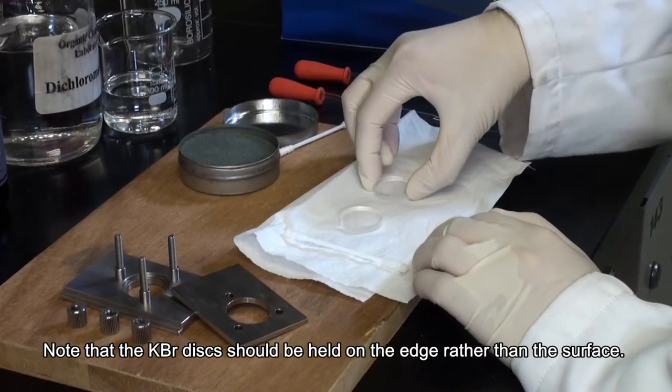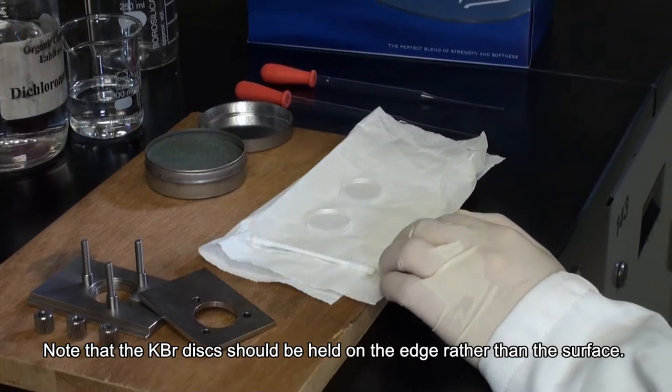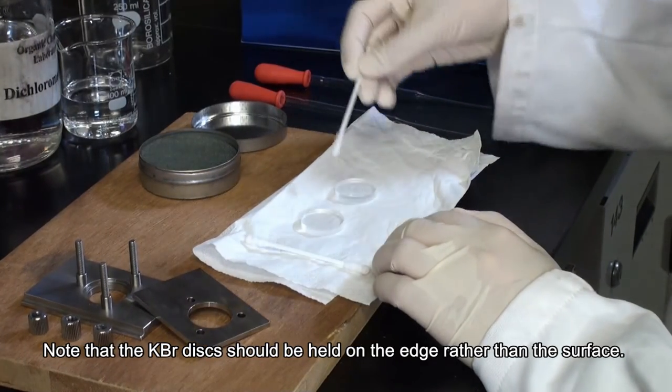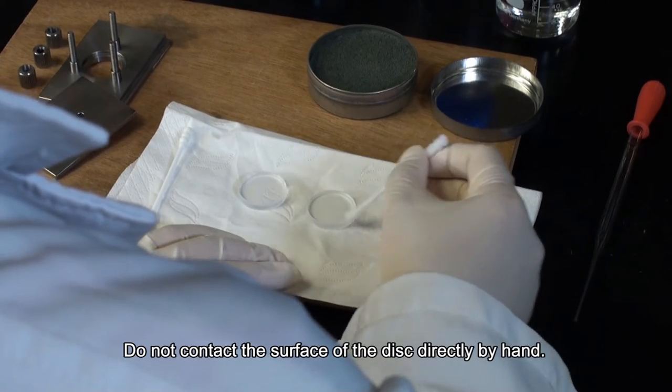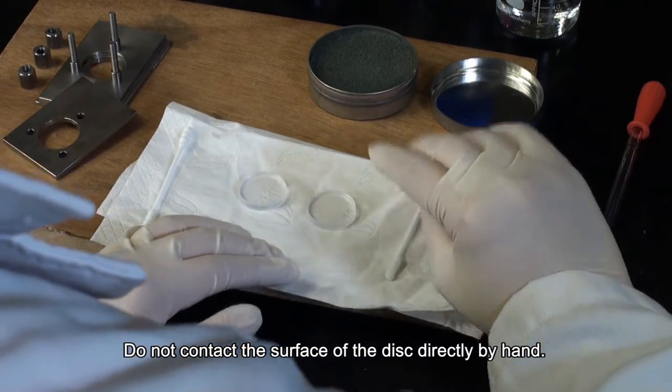Note that the KBr disk should be held on the edge rather than the surface. Do not contact the surface of the disk directly by hand.